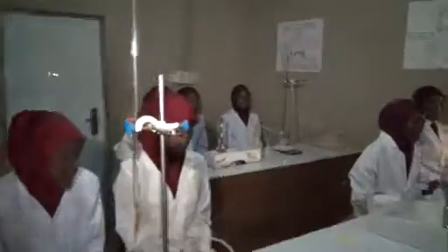Do we still have another precaution? Yes, Barry? Take the readings at eye level. Clap for her. Fancy? Avoid water bubbles when you are pipetting and when you are titrating. No, air bubbles. Air bubbles. Clap for her.